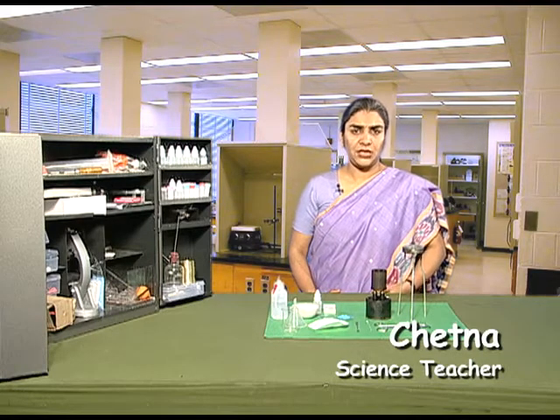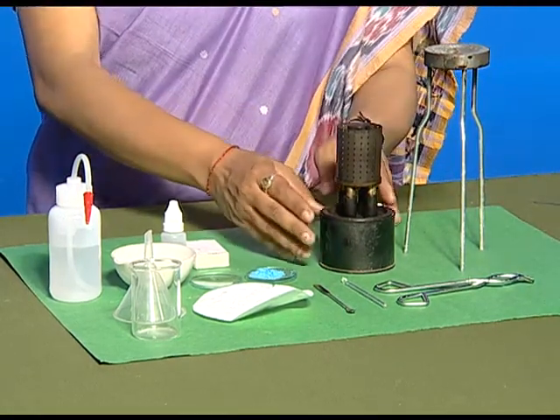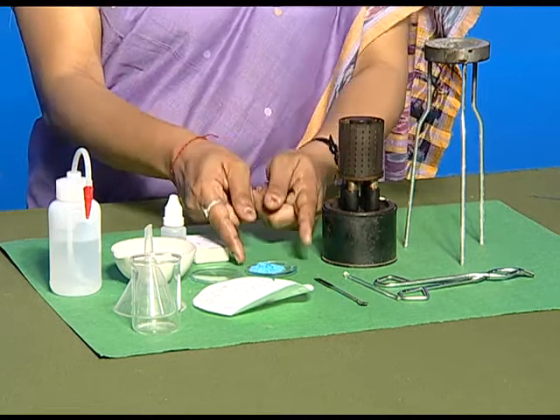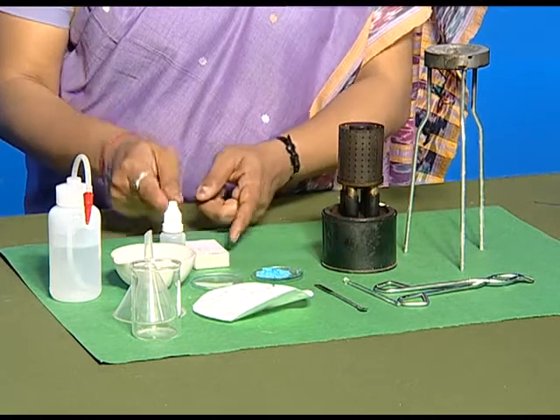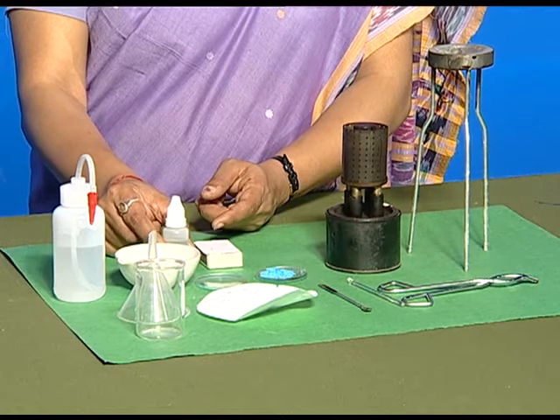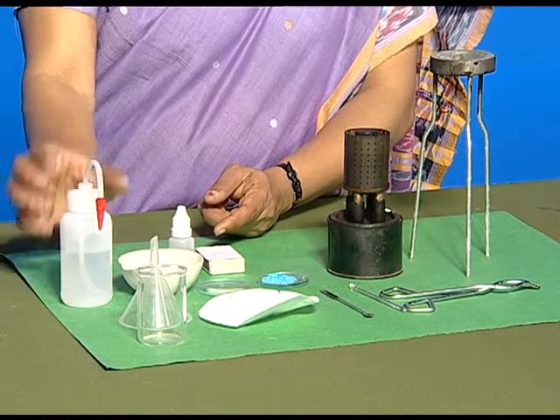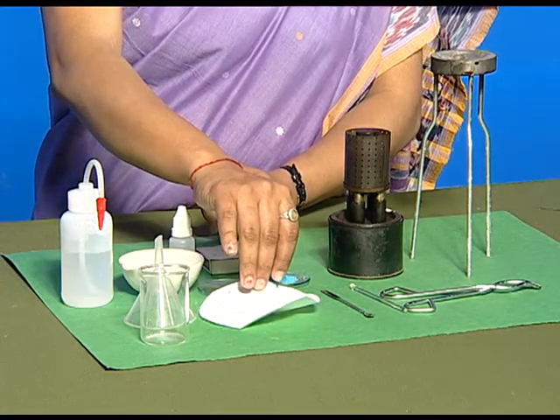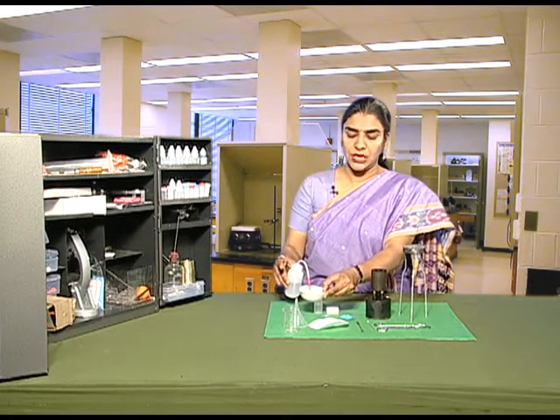For this activity, we need a tripod stand, a pair of tongs, a kerosene burner, a glass rod, a spatula, copper sulphate powder, a watch glass, a matchbox, concentrated sulphuric acid, a china dish, water, a funnel, a beaker, and filter paper. Let us first take some volume of water in the china dish.